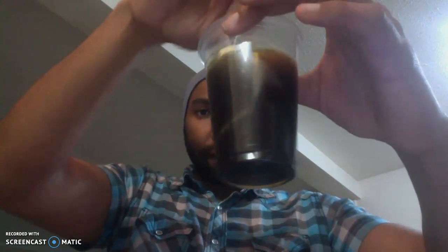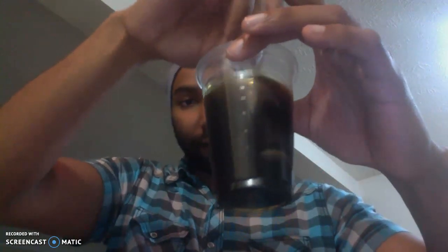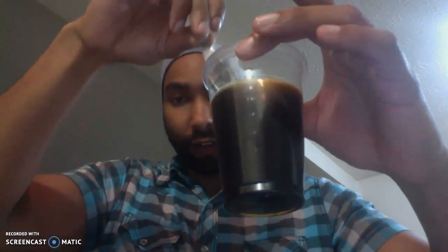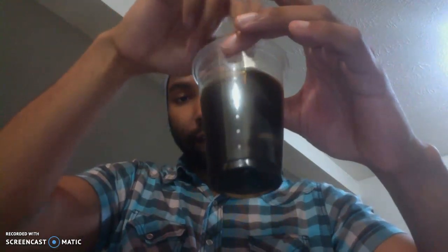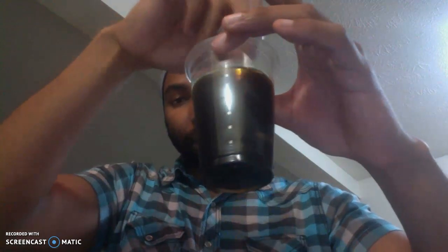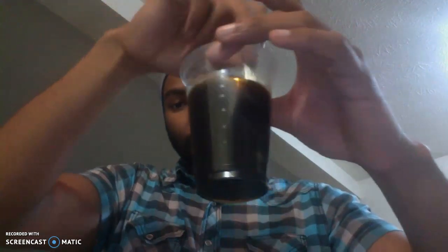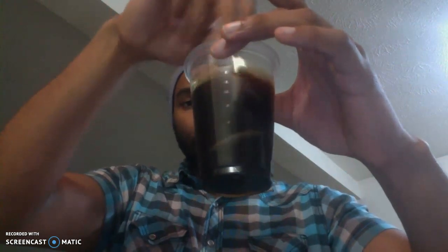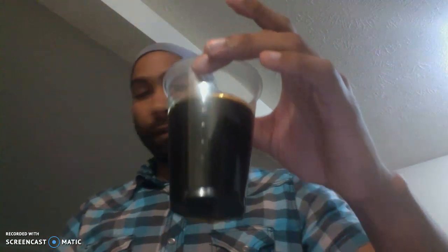It's not necessarily blue there, but the reason why it is colored and not clear is because iodine by itself in an aqueous solution is a colored solution. I think, if I'm predicting right, letting this sit should move back to clear.